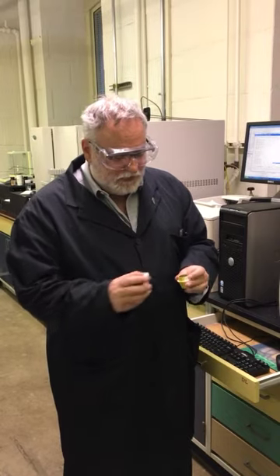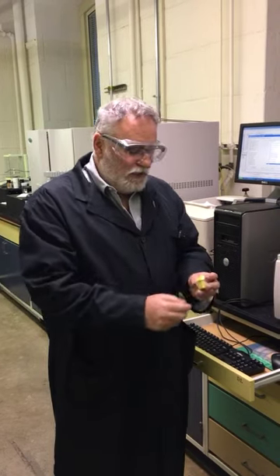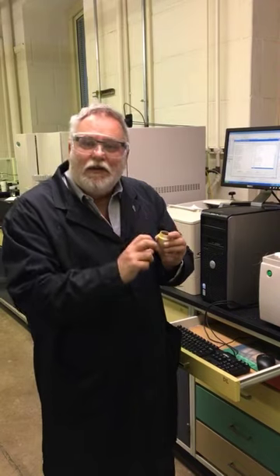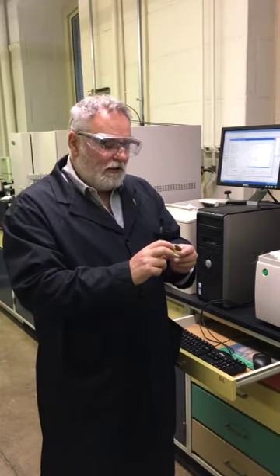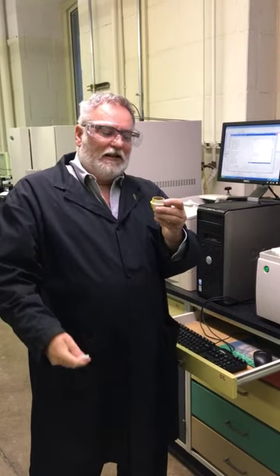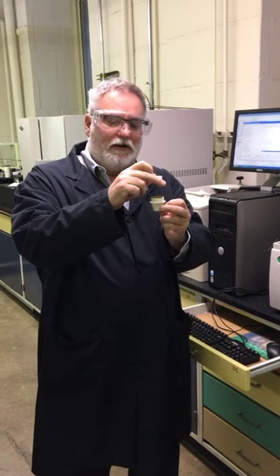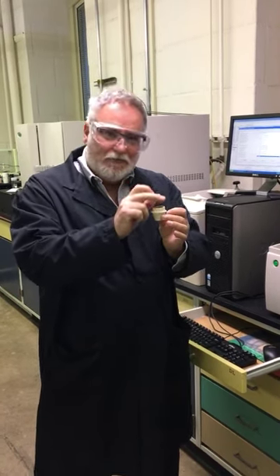The reason for the cover is to prevent coals from sparking or jetting out because of that mass loss, or fracturing and sending fragments out. In the case of bituminous coals, even though a small amount of material is in here, it will fill the crucible when it thermally expands and forms a foam, a coke, which we call a coke button, and some of them can actually raise the lid several centimeters above the crucible. So the cover helps keep it in and prevents it from overflowing.